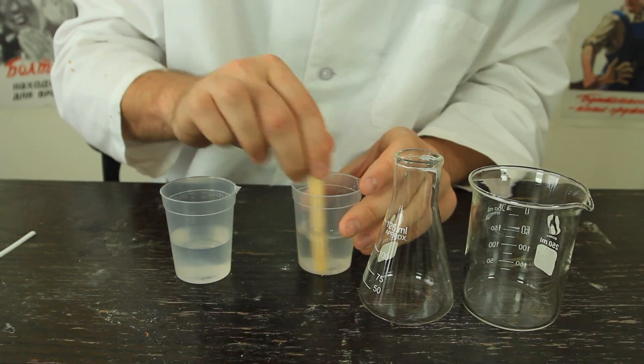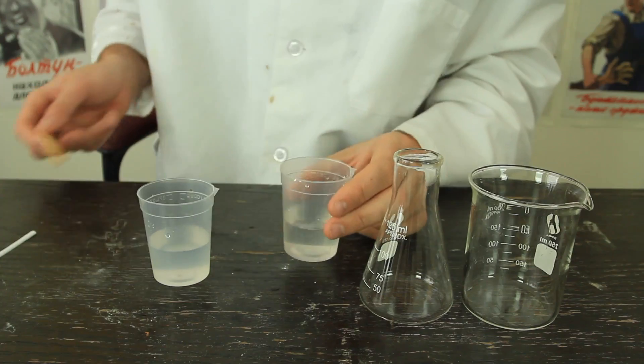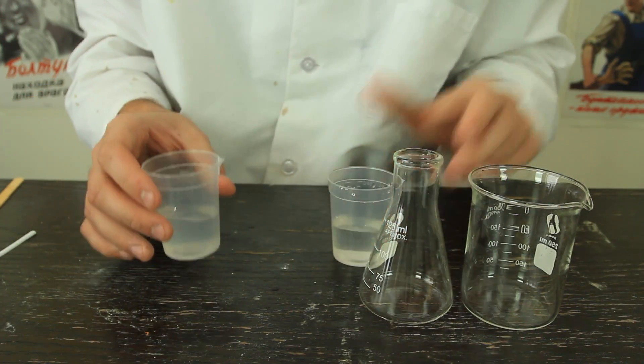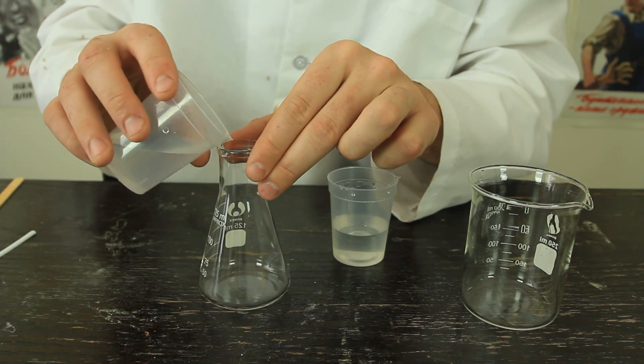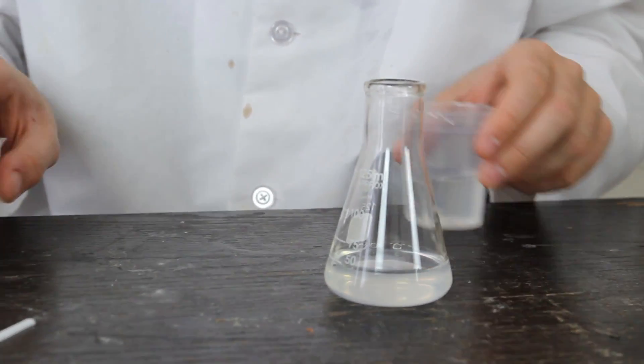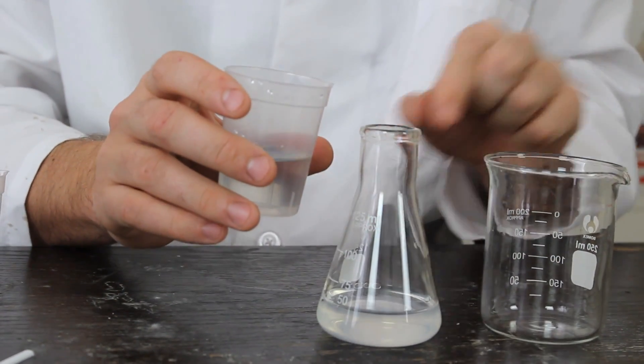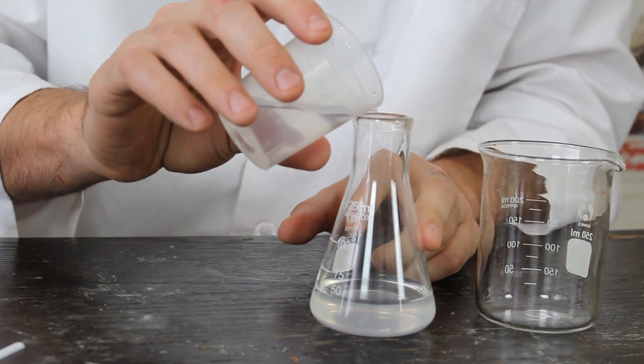Then we're gonna need to mix both of them up. Okay, after it looks like it's mixed, we're gonna pour one solution in here. Then the second one. And once I'm gonna pour it in there, I'm gonna start pouring it in here, and let's see what happens.